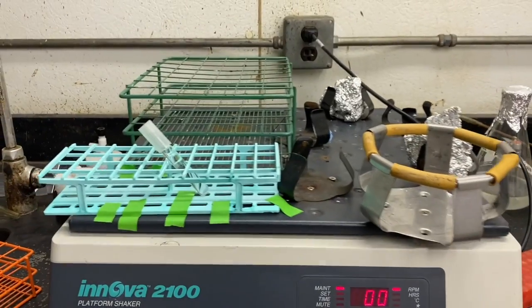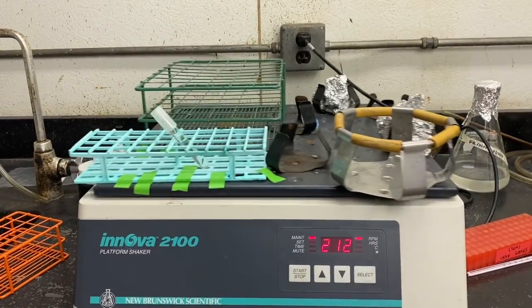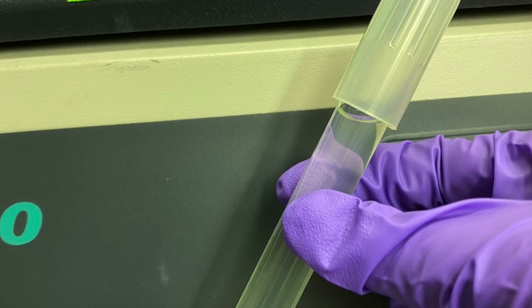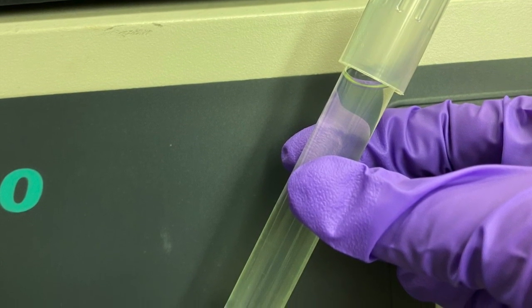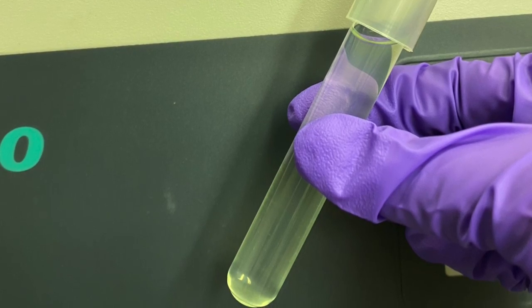Then incubate your liquid culture of the target organism, Pseudomonas aeruginosa, in a shaker tray for 8 hours at 37 degrees Celsius. After the 8 hours incubation period, your liquid culture should appear cloudy with growth. Pseudomonas bacteria has a very distinct odor. The distinct smell of Pseudomonas can be used to verify that the correct organism has grown in your culture.